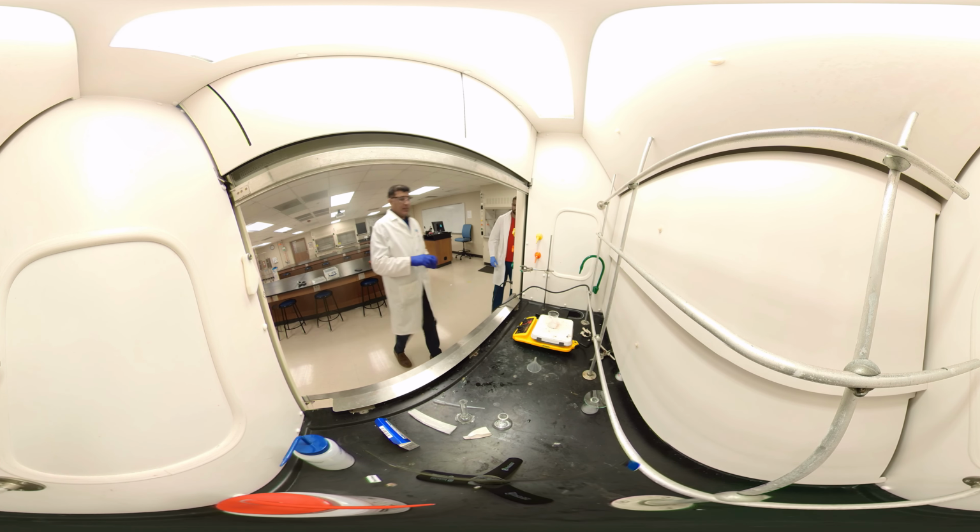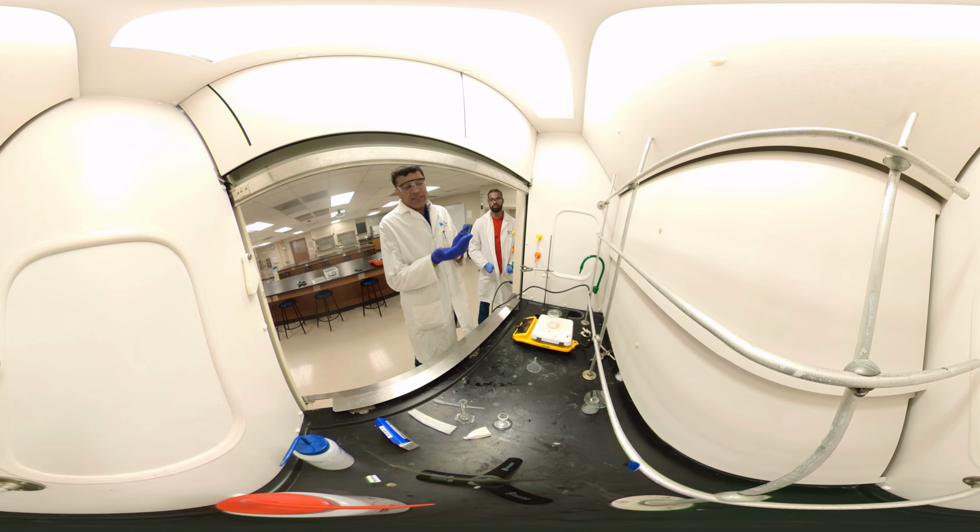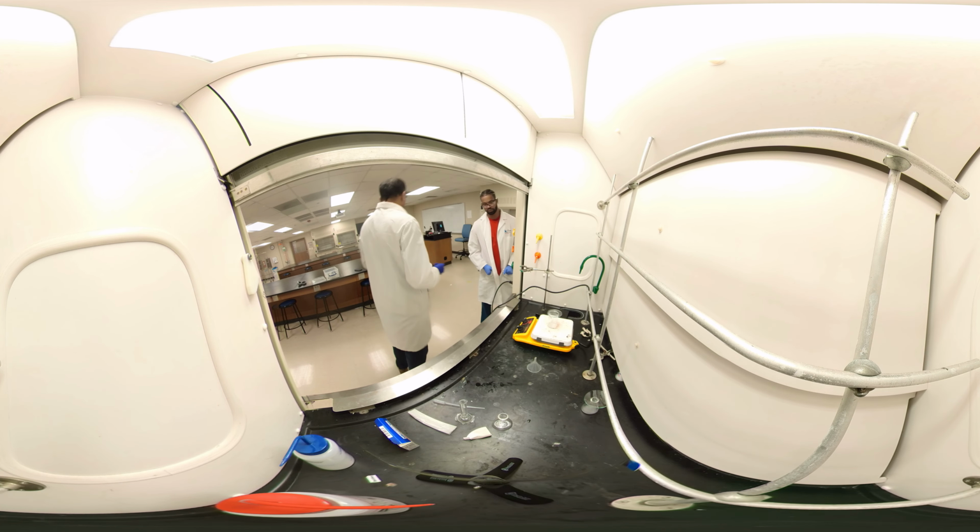Let's cover it and heat it for a while. And what happens here? The binder will not dissolve. Acetaminophen will dissolve. And we'll filter it. Whatever remains in the filter paper, that's the binder. We'll dry it and weigh it out. Whatever goes to the liquid, that's the dissolved acetaminophen. We'll evaporate it very slowly. Once we evaporate all the ethanol, we'll have the solid acetaminophen. That's the step. Okay, it's warming up.